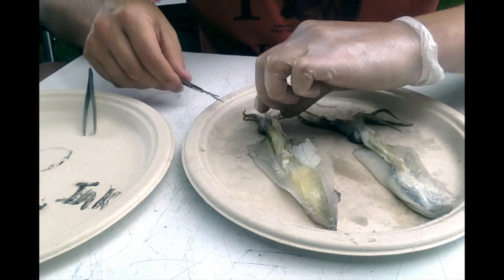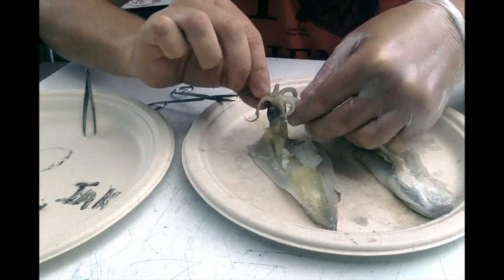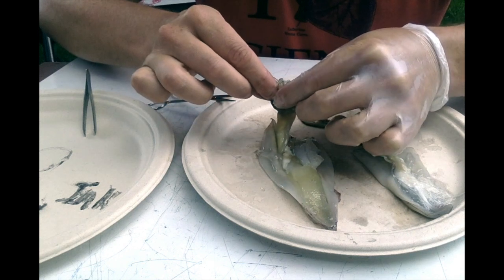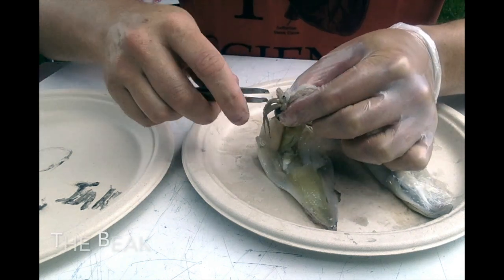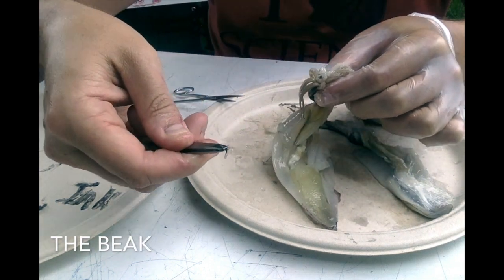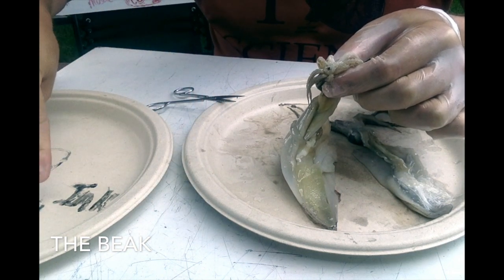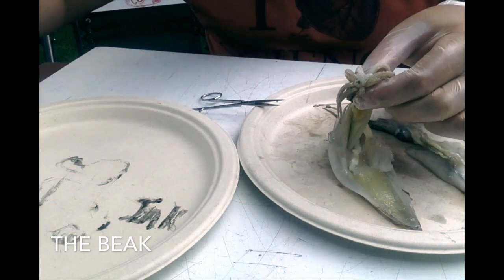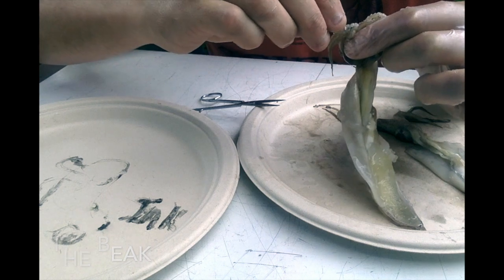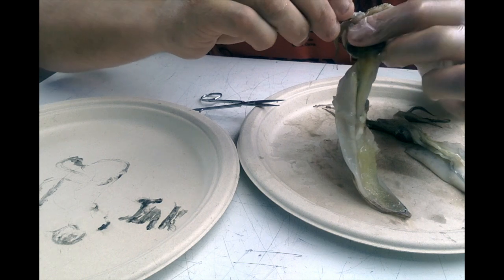If we go back to the location of the mouth and the beak, you can actually get in here. If I hold it up like this, I'm going to squeeze it and pull this beak out. And this beak is sharp and pointy, just like a bird's beak. It's pretty interesting. There we go. Let's see if you can see that. There's 2 parts to it, an upper part and a lower part, just like a beak. And this part's kind of coming apart here. It's hard to see.